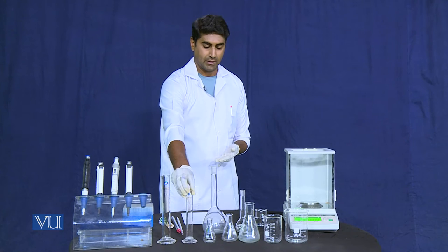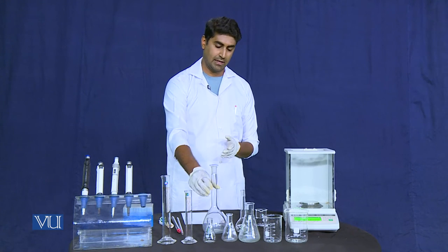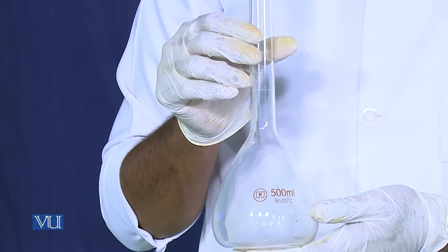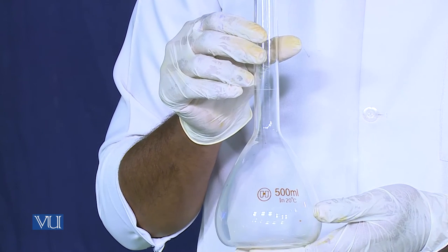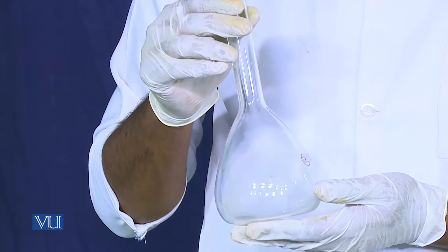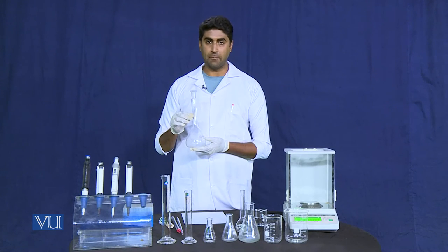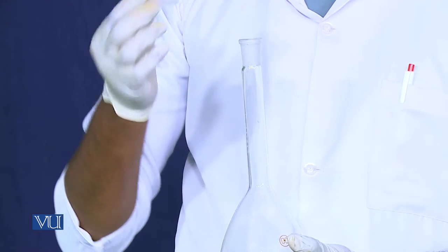The next glassware we have is the volumetric flask. The volumetric flask is used for the preparation of solutions. It comes with a fixed volume capacity — like this volumetric flask, which has a capacity of 500 ml. It can come with a stopper cap.